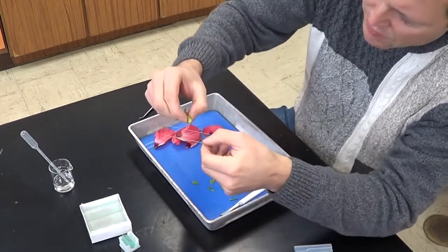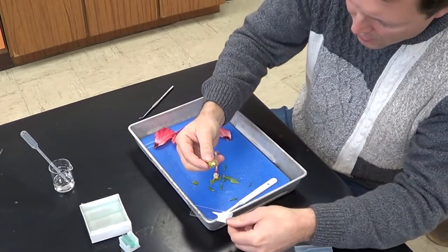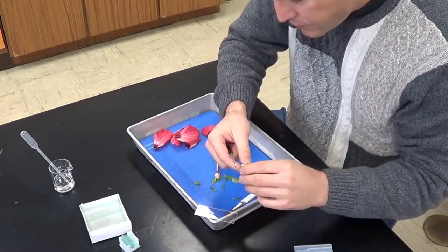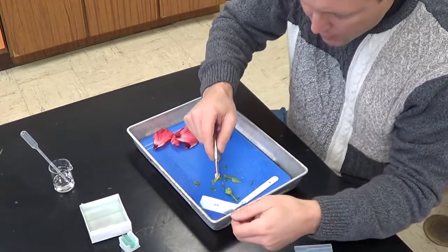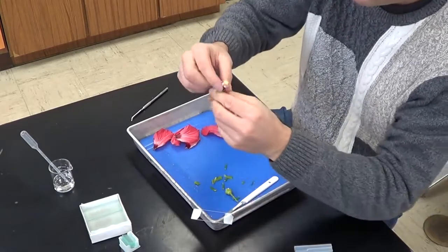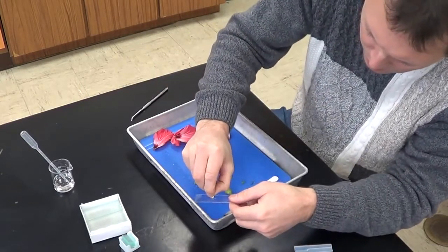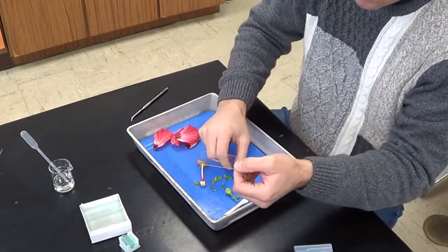And I'm going to take a few of these ovules and I'm just going to kind of squeeze them onto this glass slide. Maybe with the help of my probe, I can get some of these ovules on here. And I've got one ovule on there. I can actually take the other half of the ovary and I can do the same thing to it. You can see the ovary right there. If I squeeze it, again, some ovules begin to come out. And now I've got two ovules on there.